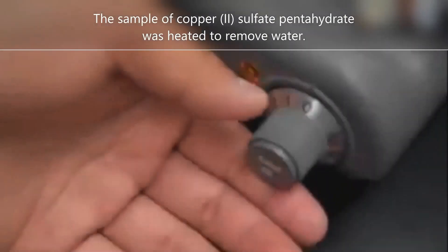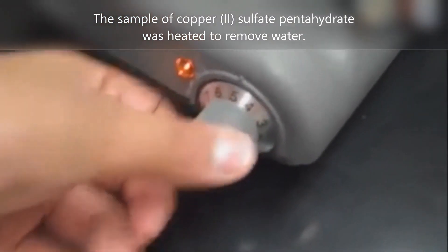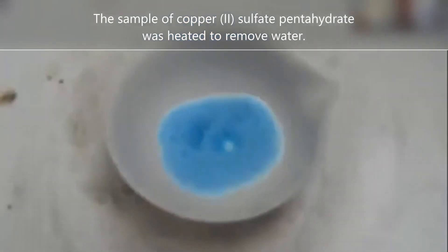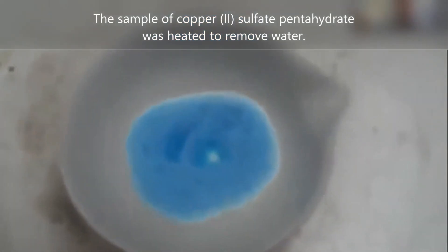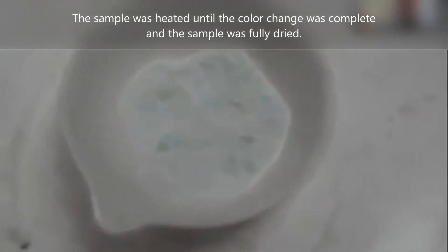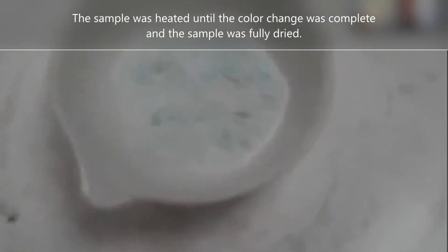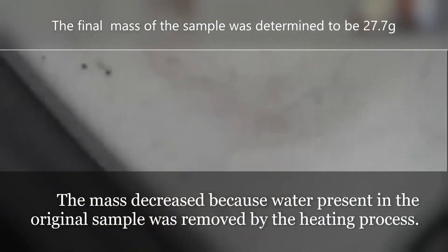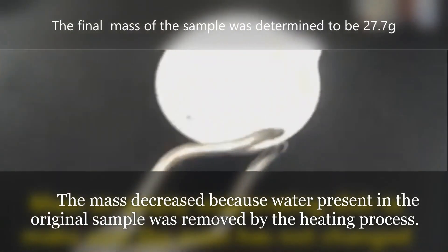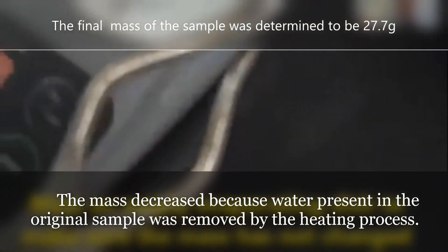Heating a hydrate causes water in the crystal structure to convert to steam, which dries the salt sample. As copper sulfate is heated, its color changes from a dark blue color to a much lighter color as the sample dries due to the conversion of water to steam. The resulting material is called an anhydrous salt, or anhydrate, and takes on a powdery appearance.